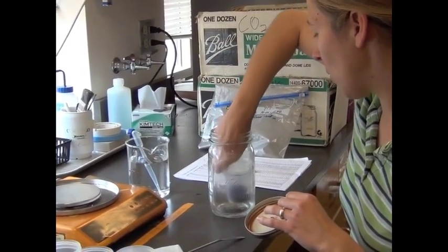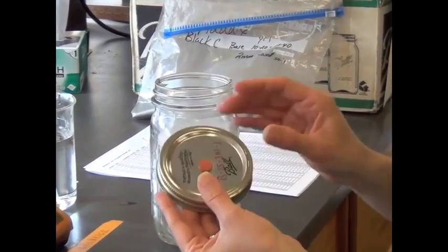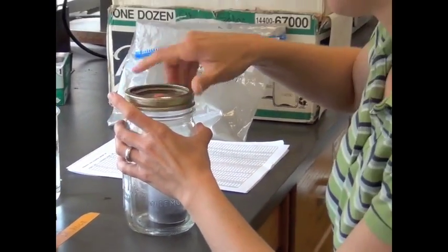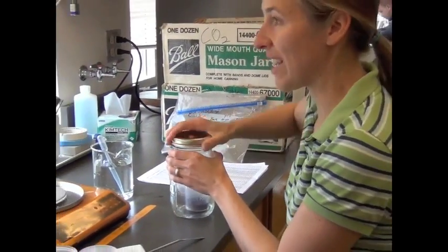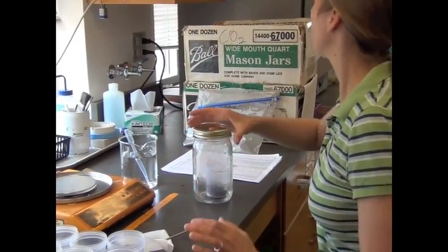And then we put our soil in here. Each of the jars is fitted with a little septa. That's where we're going to take our CO2 measurement from. Then we just need to put the lid and the rim on and make sure they're nice and tight. We have to make sure they're airtight for us to measure the CO2 concentration properly.